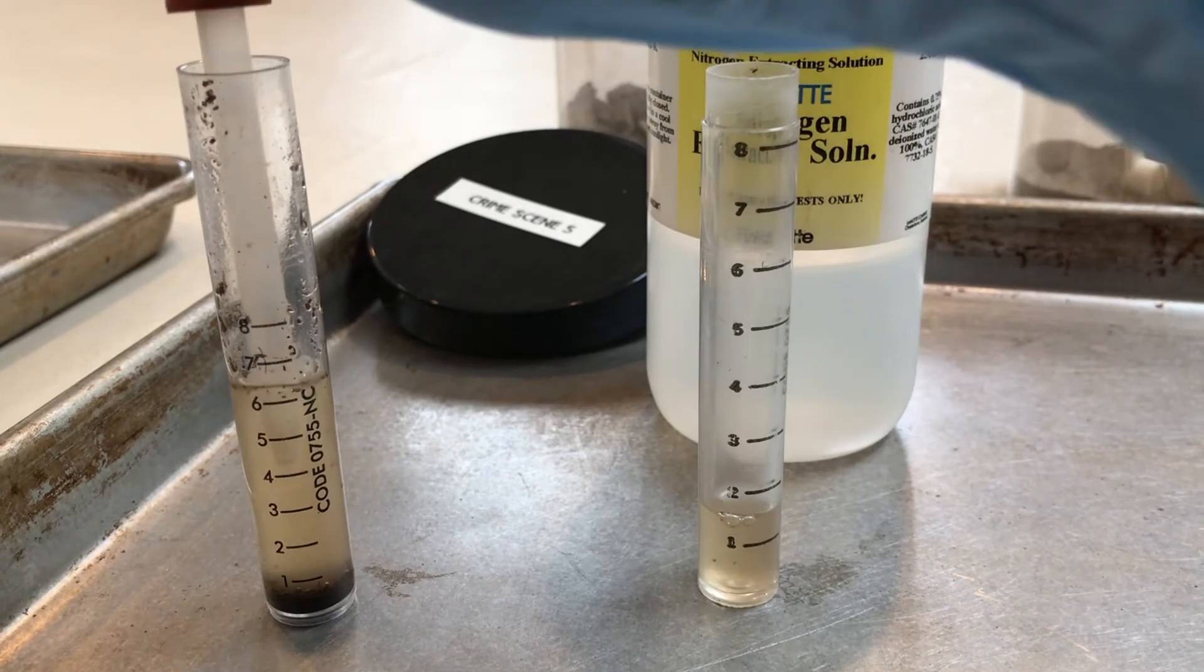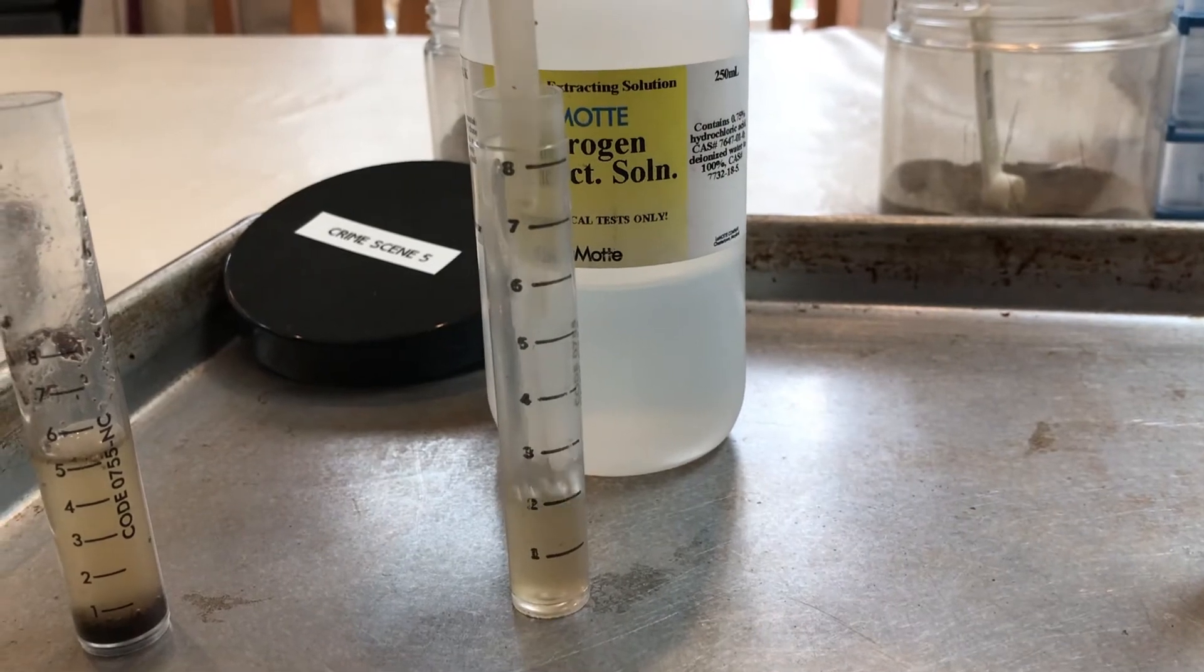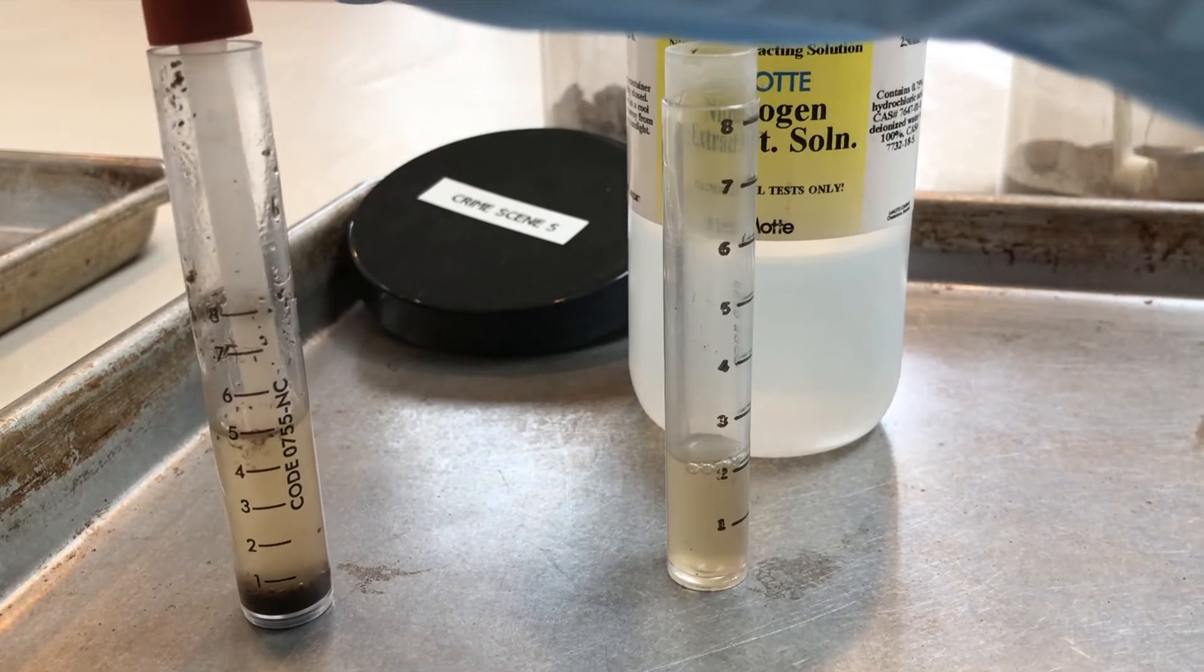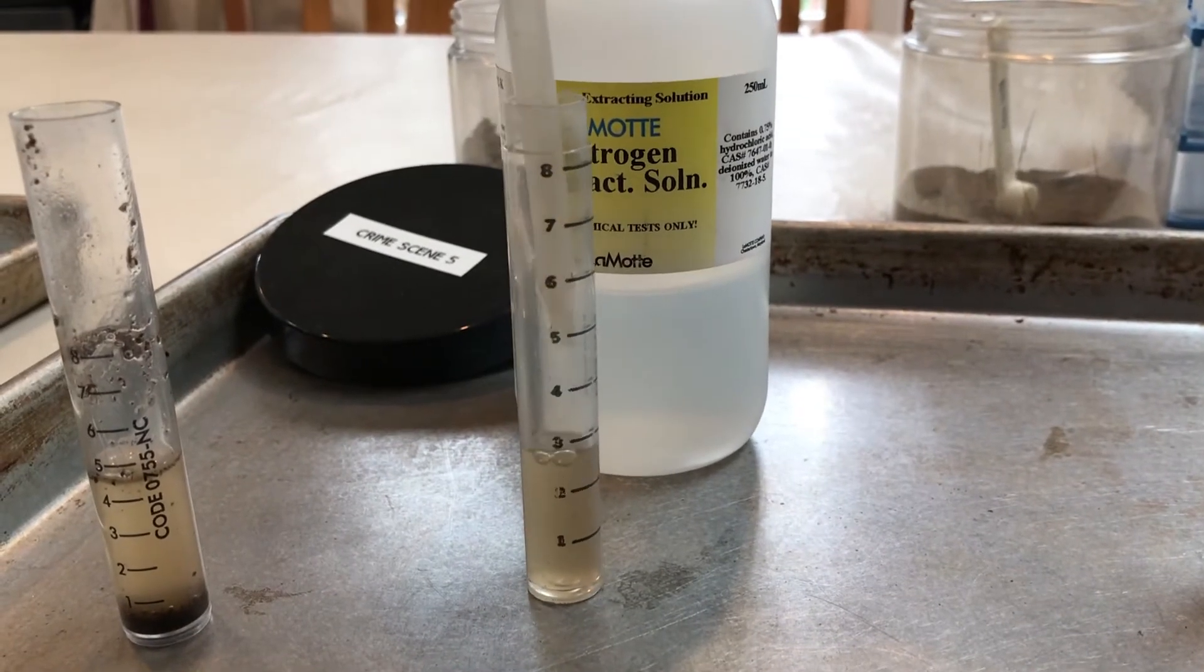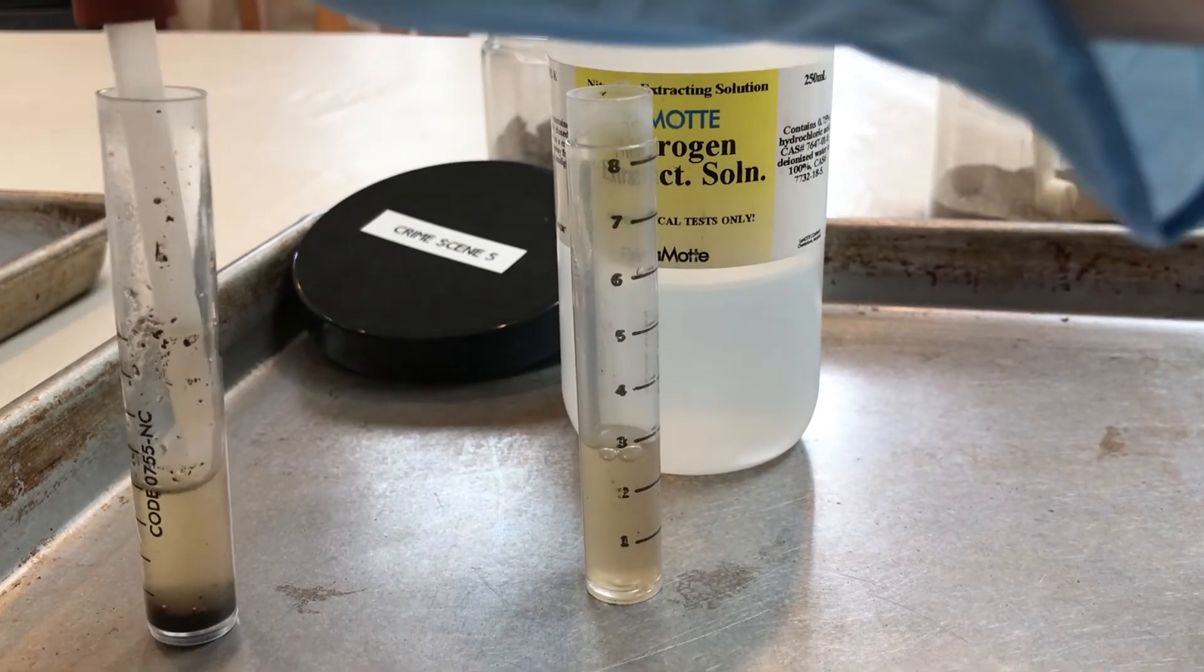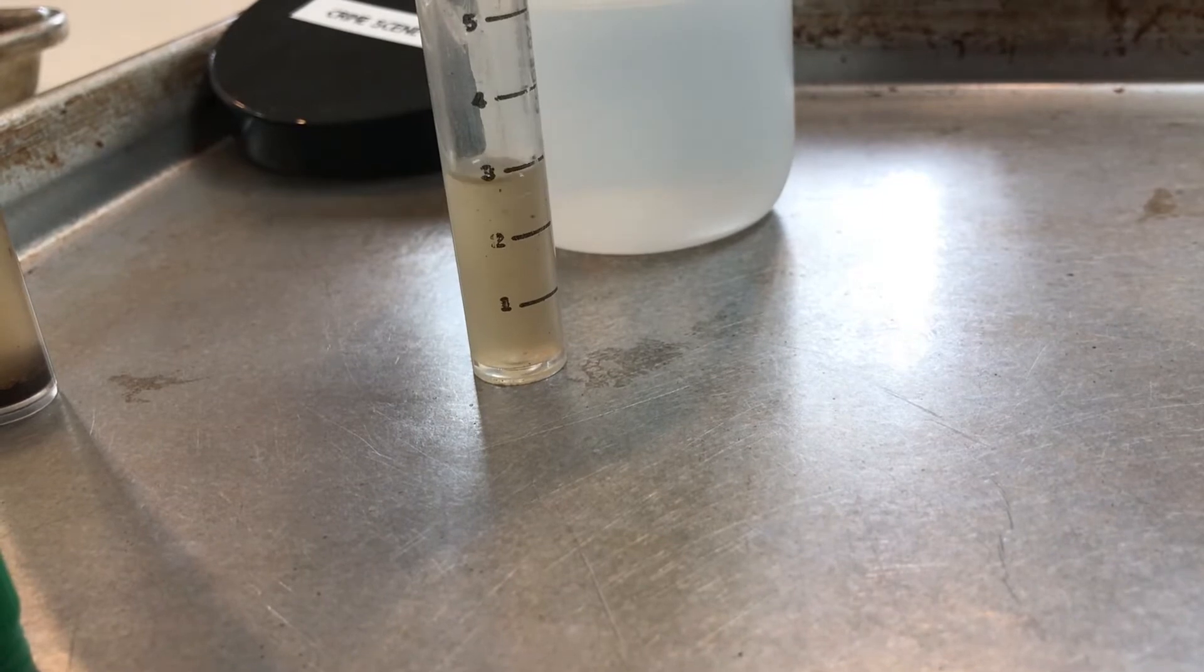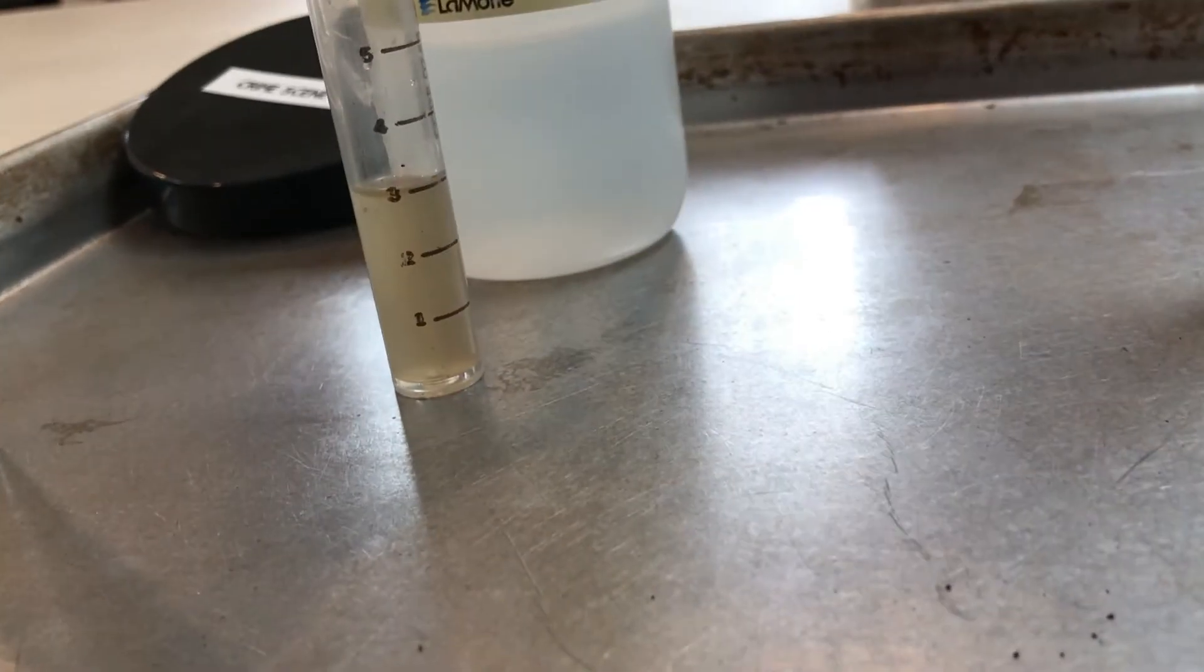Hopefully we can do it without spilling. And just a little bit more. That should be just about right.